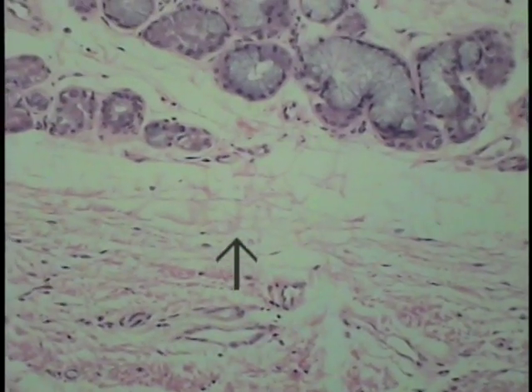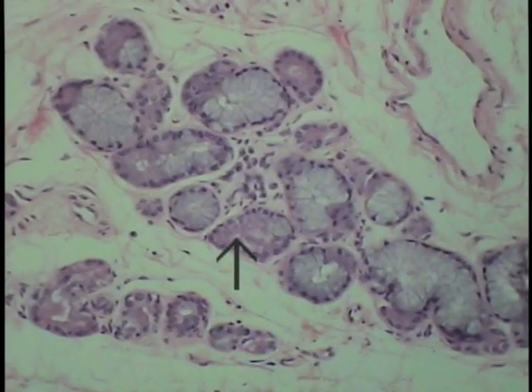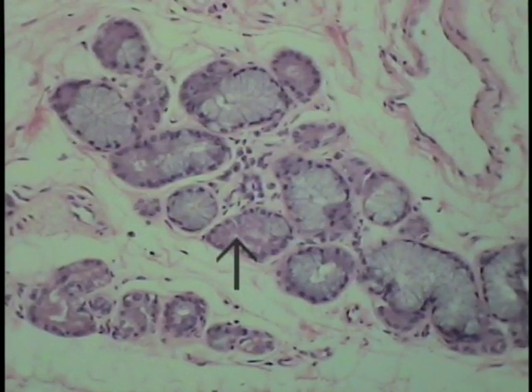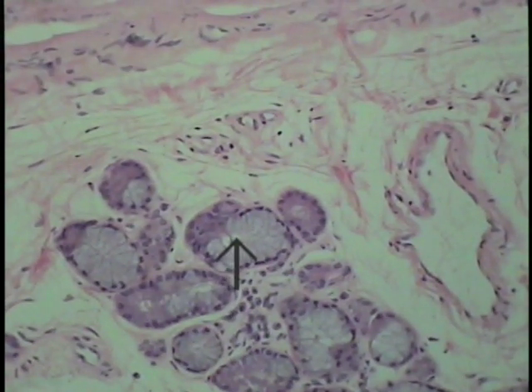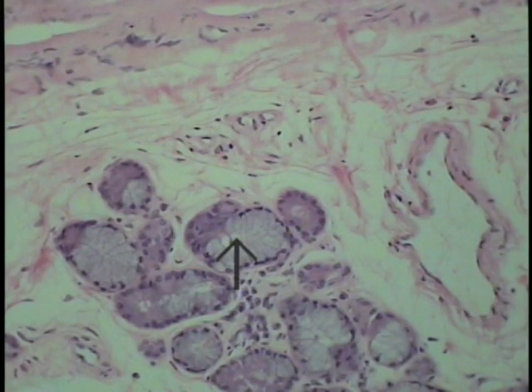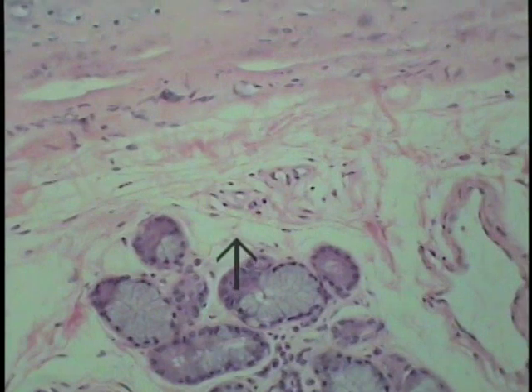We then go, without much of a boundary, into the tracheal glands and their typical appearance, a mixed compound tubular alveolar form of gland that's providing secretion, in addition to goblet cell secretion, to the luminal surface.